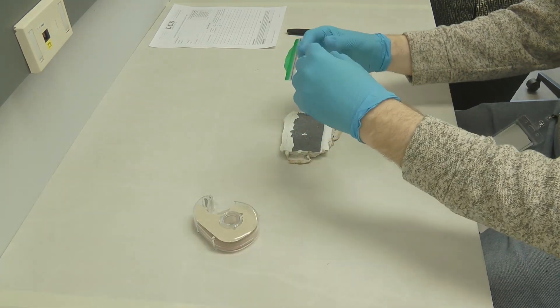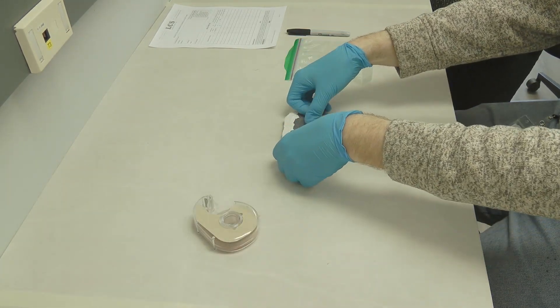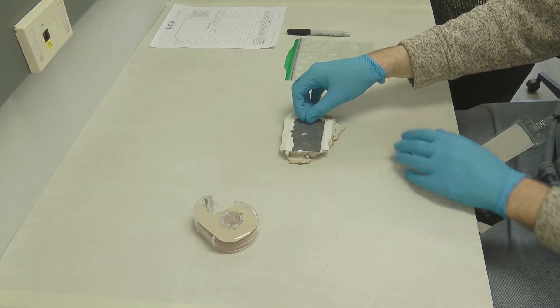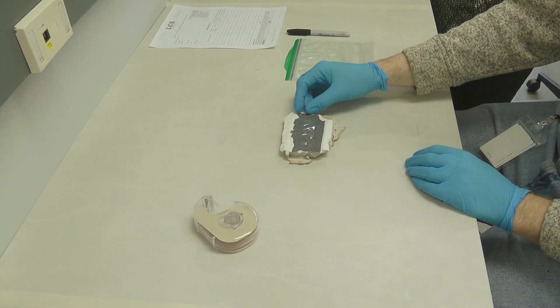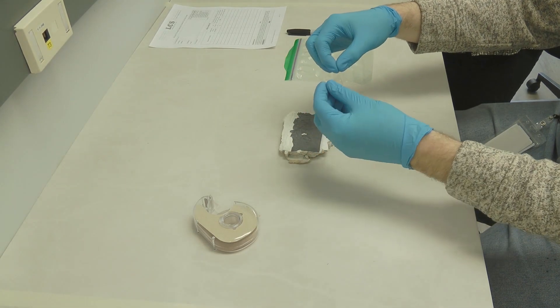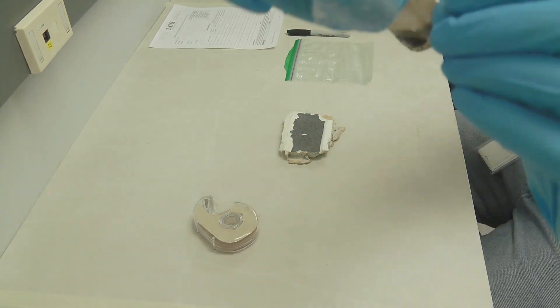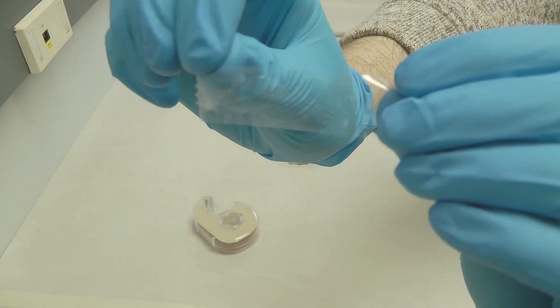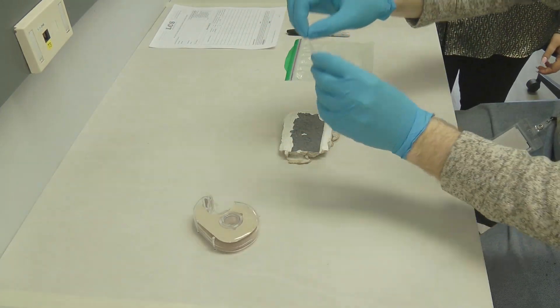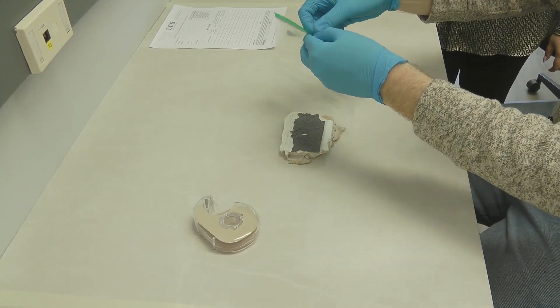Next, find the place where you suspect the mold outbreak to be. It can be any dry solid surface like a wall, floor, or ceiling. Start by tearing off a small piece of transparent tape without touching the sticky surface. Hold the tape by its ends and press the sticky side of the tape onto the mold spot that you want us to evaluate.